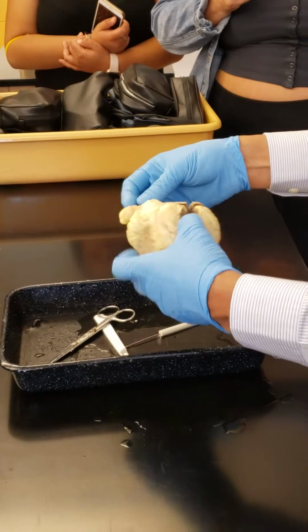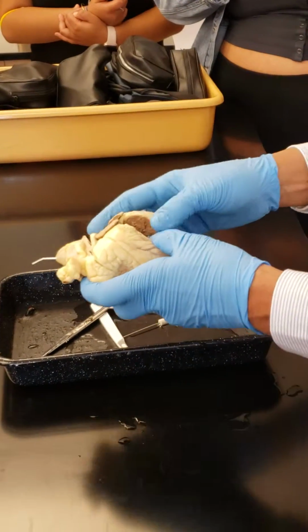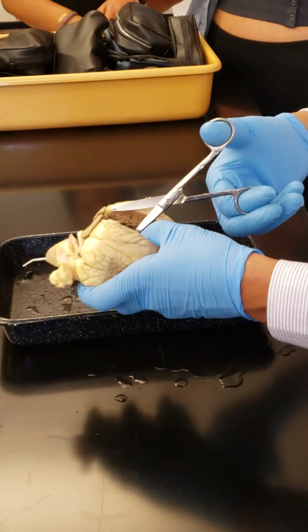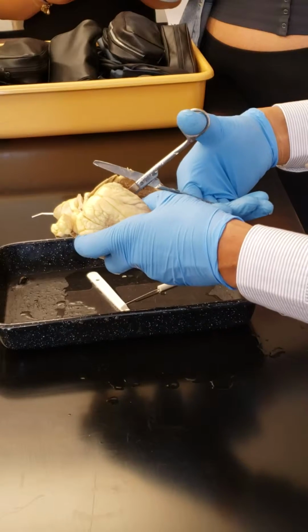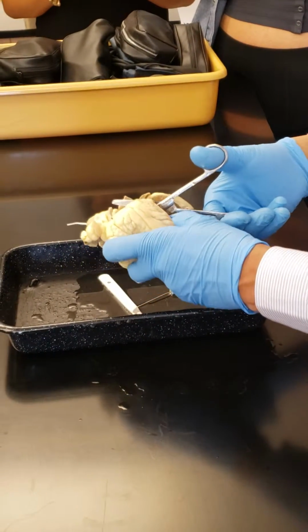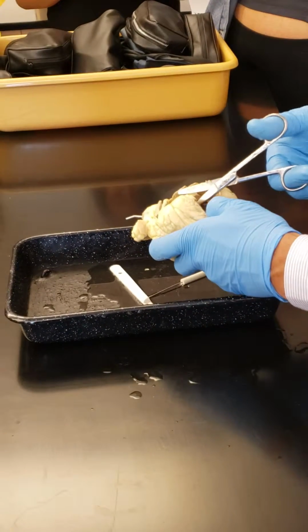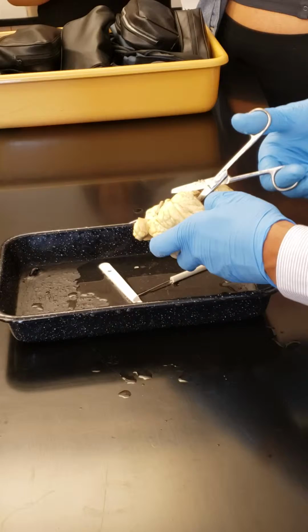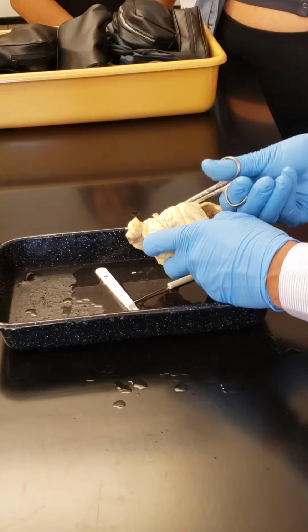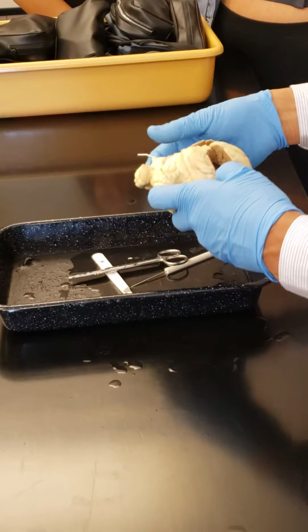So because I have this probe now, I know where to cut on top of that. I don't need to cut, I can show like that, but it will be difficult for you to see. So I give it a cut like this on top of the probe. Again, I don't try to cut all the way, but just to show you, it will be easier for me and for her to show you.